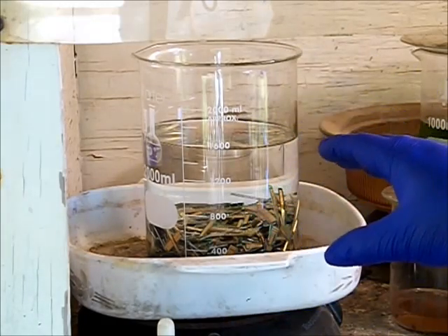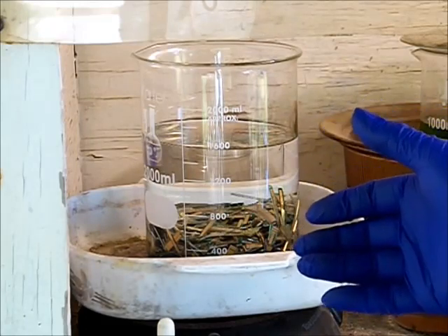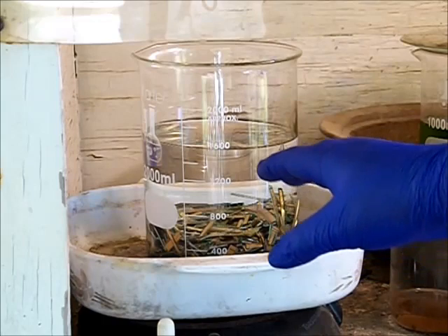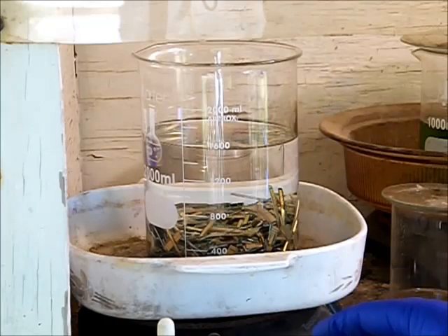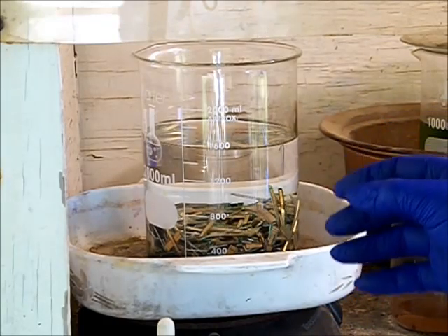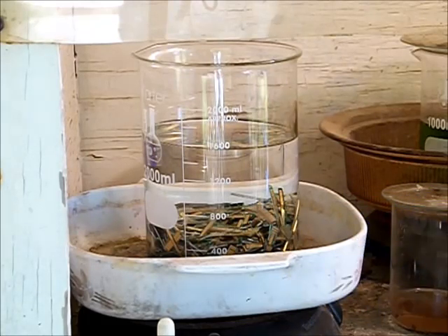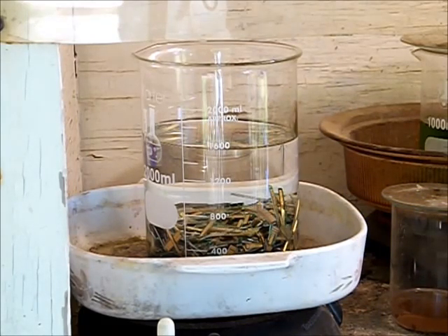You have to start the process with this in mind. As much material as I have in here is going to create more salt than this amount of water is going to be able to hold, so about midway through I'll have to remove the solution and replace it with fresh water and fresh acid.